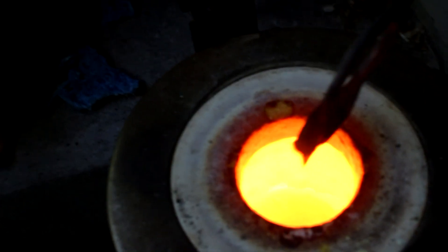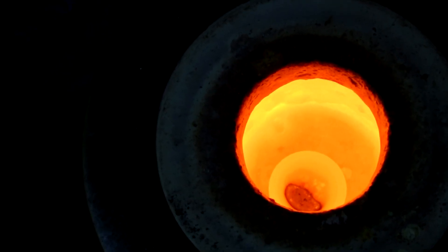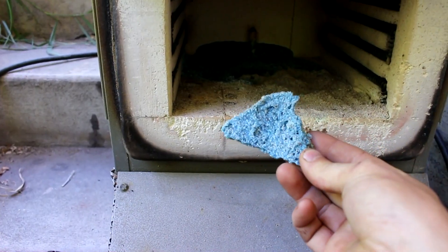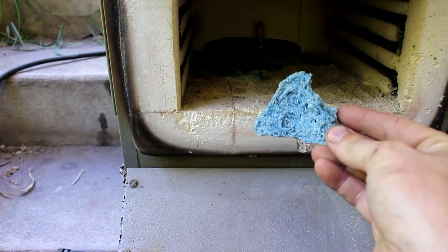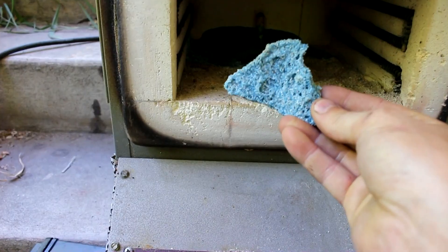After breaking off the slag and putting it into a cupel to remove the lead, the piece of metal actually puffed up like popcorn in the cupel, which means it wasn't pure lead — it must have had some tin or something in it. The best fix is to add more pure lead to lower the tin content and hopefully get that oxide to dissolve into the cupel, or get it really hot. I decided to try adding more lead. While cleaning spilled slag out of the furnace, I noticed it was bright blue — probably copper carbonate — just proof of the really weird stuff in electronics.